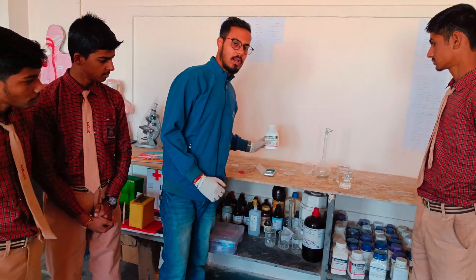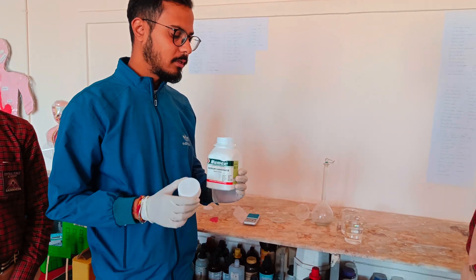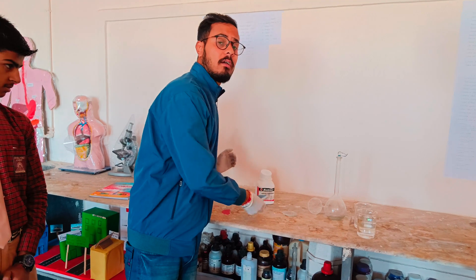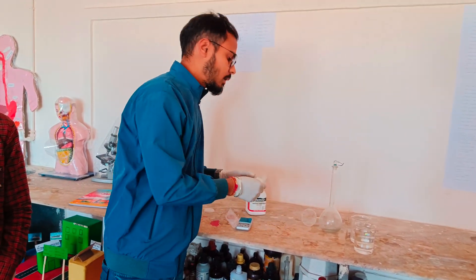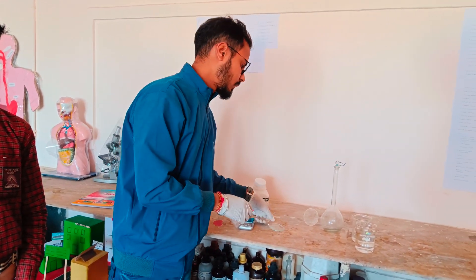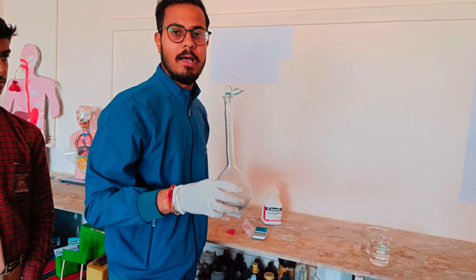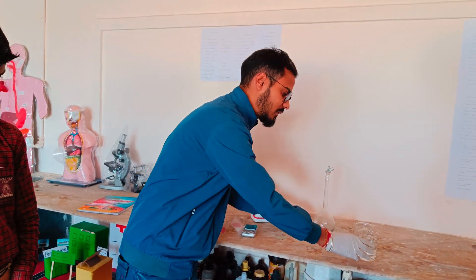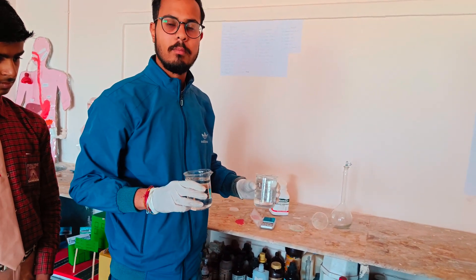We have sodium carbonate in crystal form, that is the powdery form of sodium carbonate. Here we have a weighing balance — you can say a weighing machine — a watch glass in which we will take out the crystals of sodium carbonate, a conical funnel, a 500 ml measuring flask in which we will pour the sodium carbonate crystals, and two beakers in which we have filled water for the required preparation of the solution.